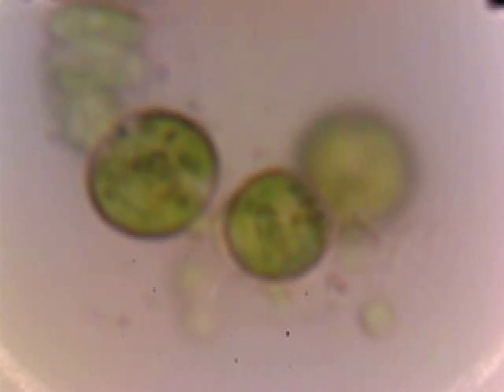In this video you'll notice that we have some assorted cyanobacteria at fairly high power. You can see many of the internals, but the details are indistinct. Now watch this.